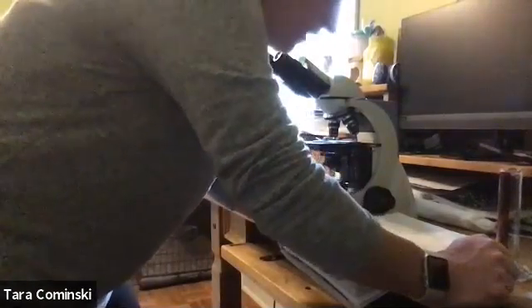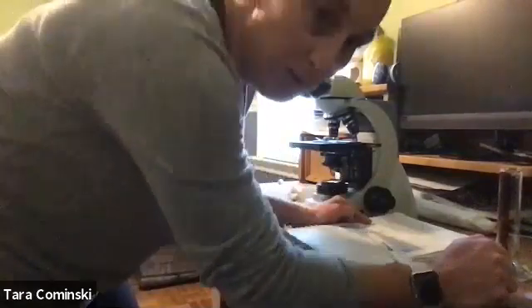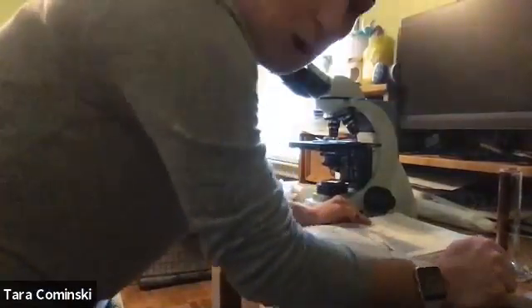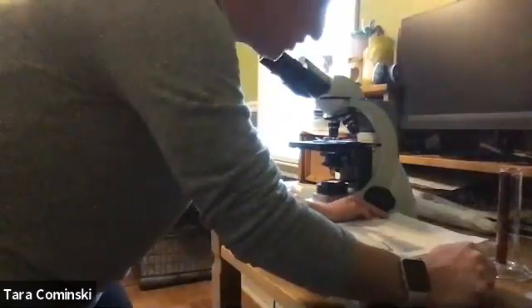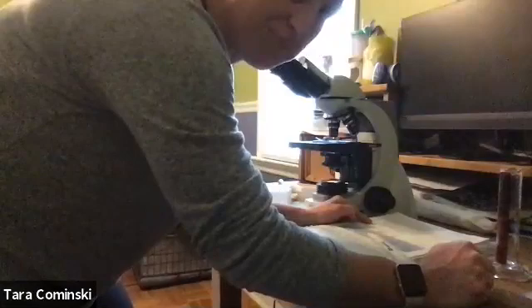Now it says record the length of 2 bones. So I'll just give you the length of 2 bones. The first bone is 12 centimeters and the second bone is 25 centimeters, okay? Do the conversion, right? So that was for number 4 and for number 5 on page 11, okay?